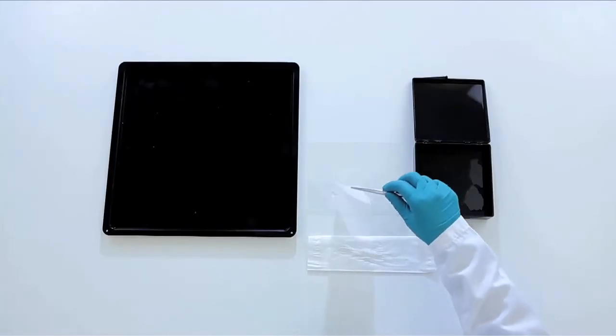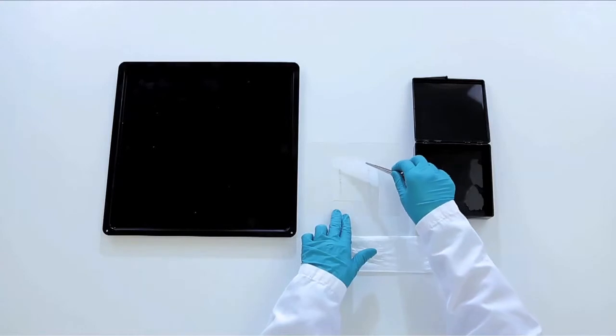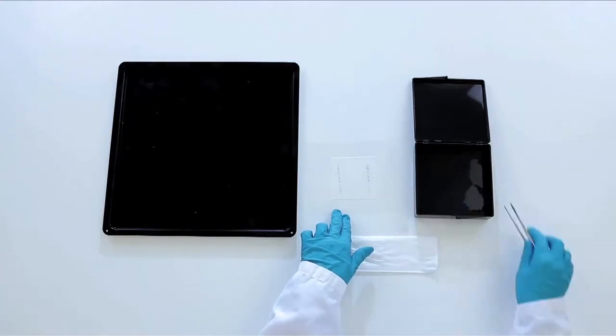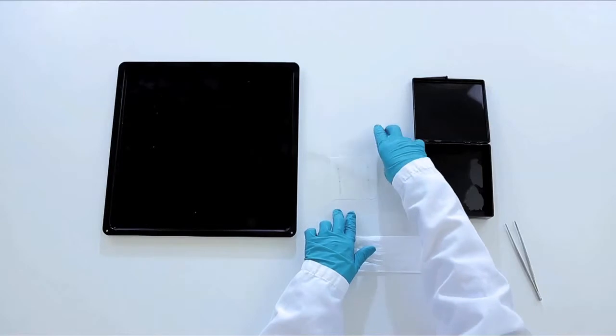Drain excess reagent from the membrane and place on a clean, smooth surface, such as plastic film. Now you are ready for detection.